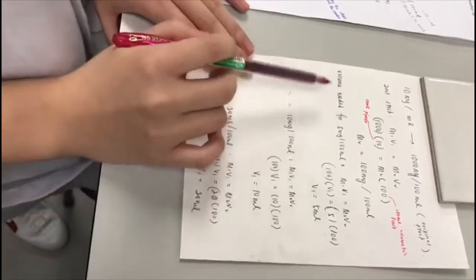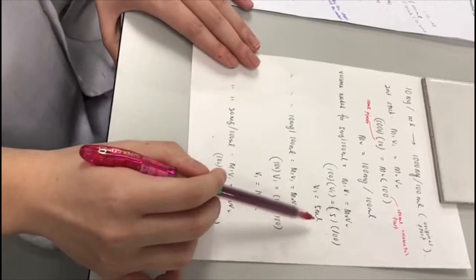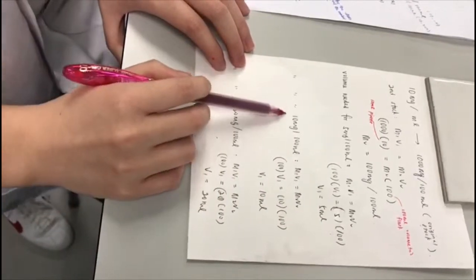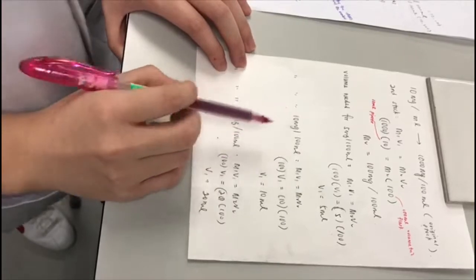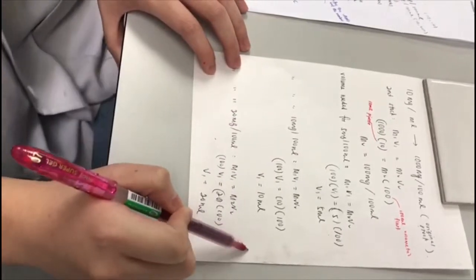The volume needed for this concentration will be 5 ml, which we can obtain by using a 10 ml pipette. And the volume needed for 10 mg per 100 ml will be 10 ml, which we can also obtain using the 10 ml pipette available.